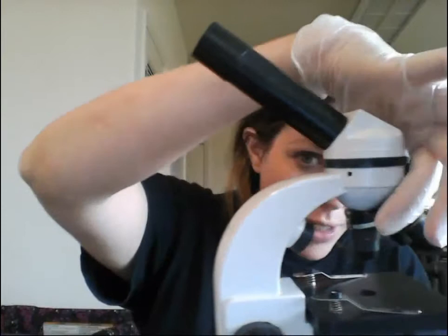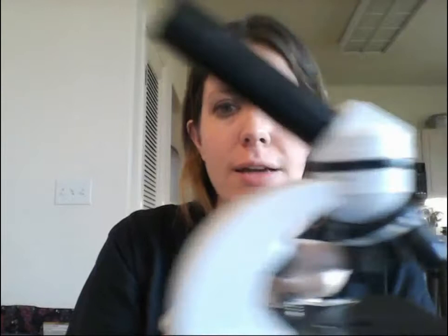So to recap the parts: ocular tube, ocular lens, head, nosepiece — always turn it clockwise for these scopes — and objectives with objective lenses of 4x, 10x, and 40x.